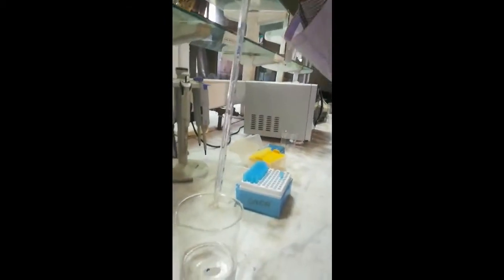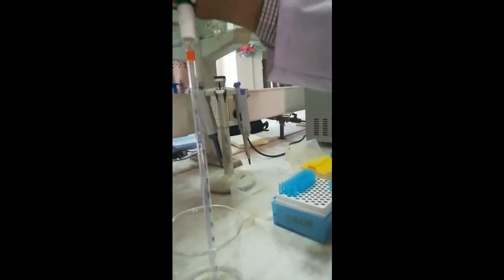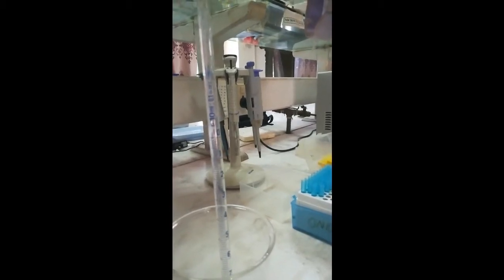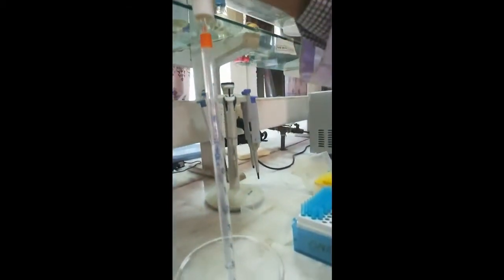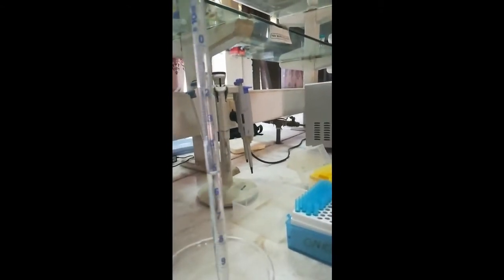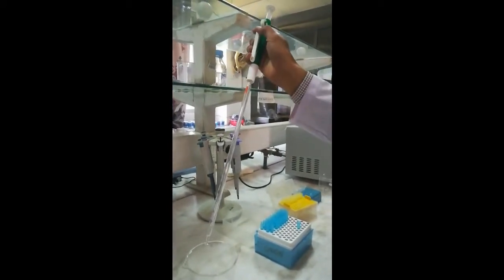If we have this liquid and want to measure five ml, we dip the pipette in the solution and rotate the circular knob to draw up the volume. After measuring, we use the button to release and pour the liquid from the pipette. This is a very simple way to use the glass pipette.